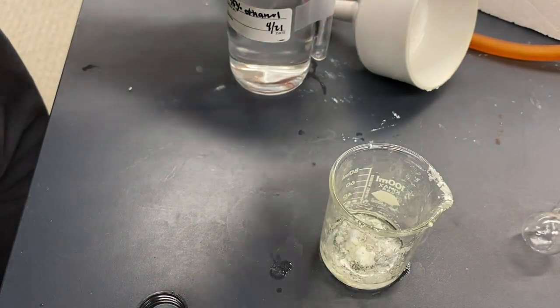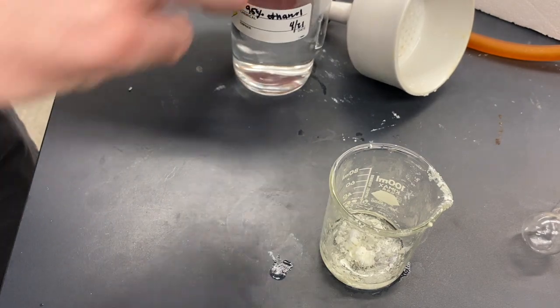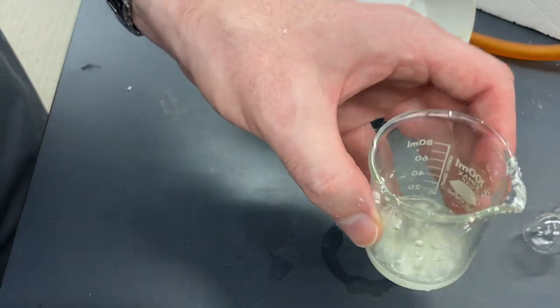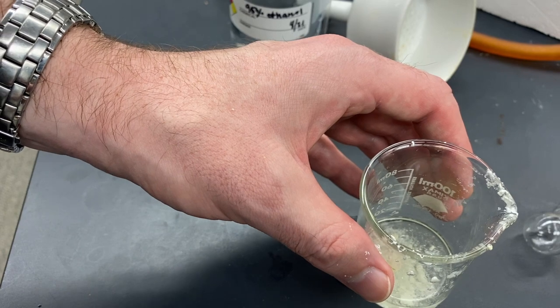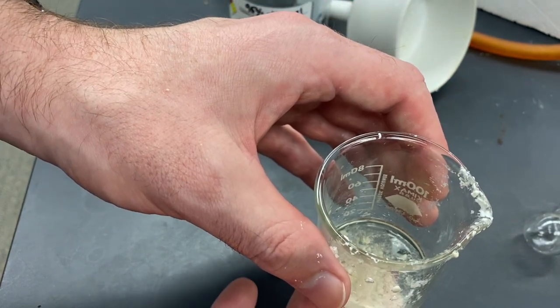Because the product should not be very soluble. That's the whole idea — we want it just somewhat soluble. I'm going to go ahead and get this on a thermal well or a hot plate, warm this up and try to get all of this to dissolve.